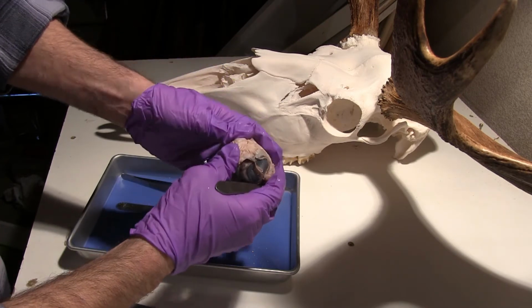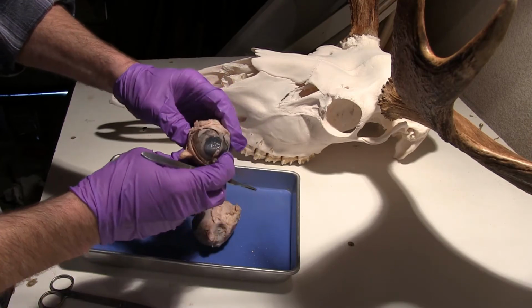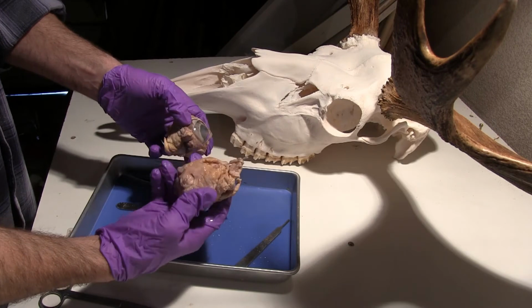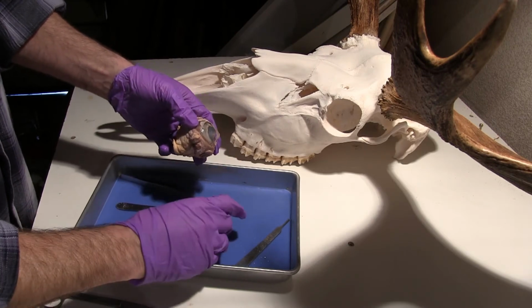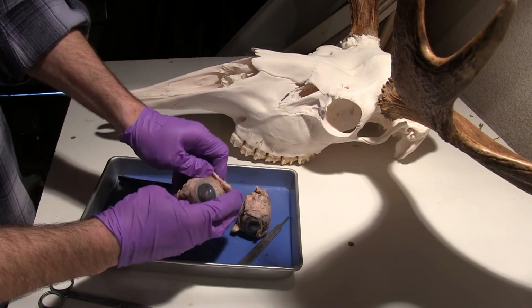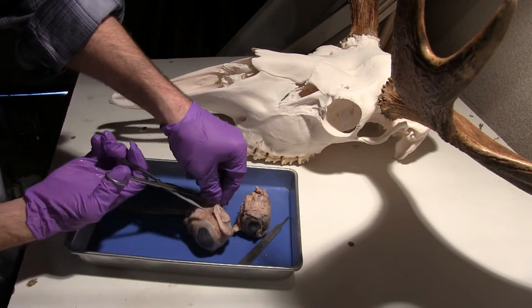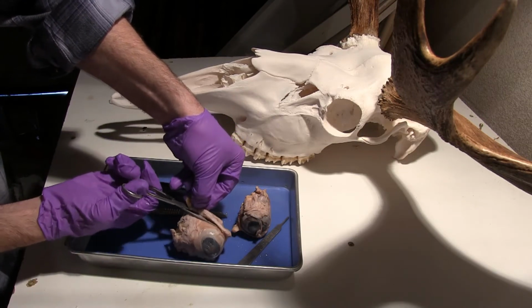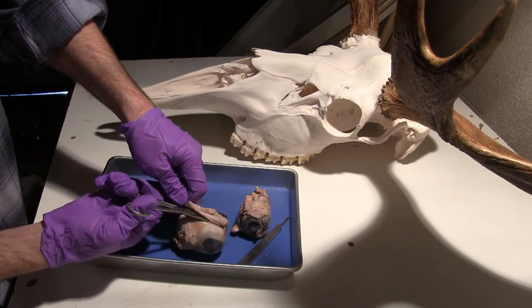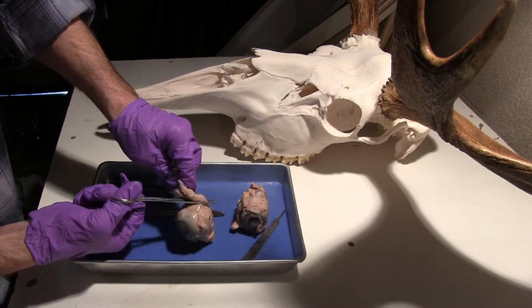And if I come back to the front here, what I want to do now is remove some of this fat from the outside. So I think I'll keep this eye intact and I'll open this one up. So what I'm going to do first is just use the scissors here. There's a lot of material that we're trying to remove, and we can do it faster with less danger of cutting ourselves than with a scalpel going like this.